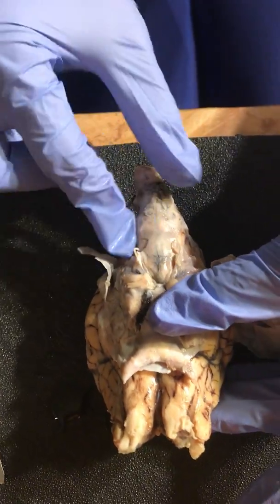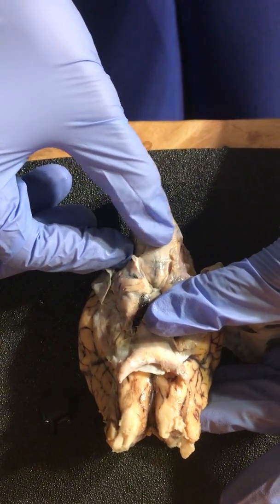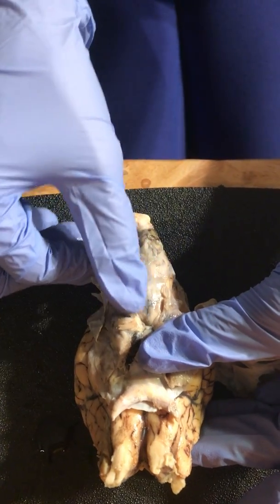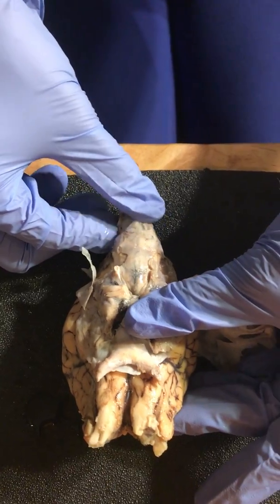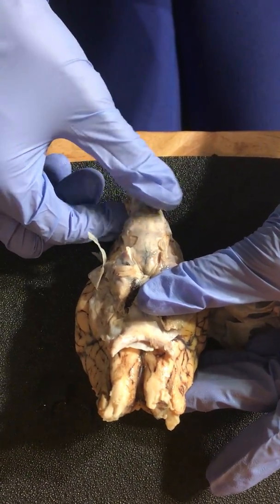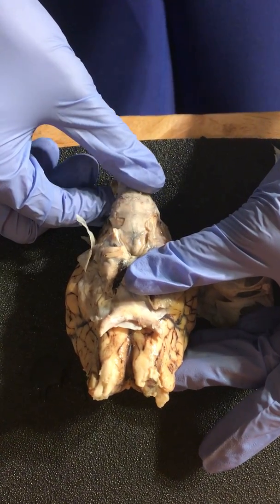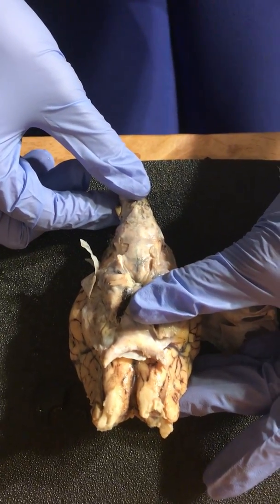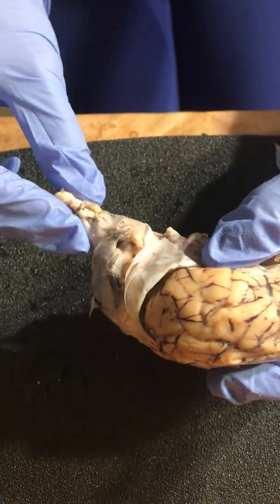So the pons is going to be this circular area here. The pons are the area of the hindbrain that sits directly above the medulla. So right below that is going to be this area here. So the pons is up here, and then we have the medulla. The medulla oblongata is the lower portion of the brainstem. It is inferior to the pons and anterior to the cerebellum, which was here, the cerebellum.